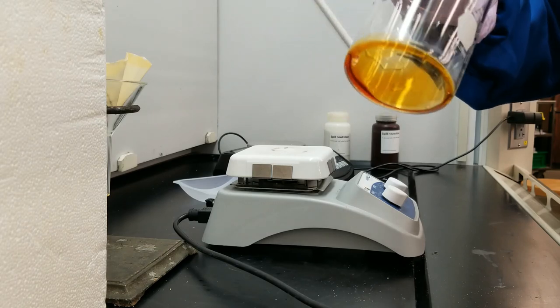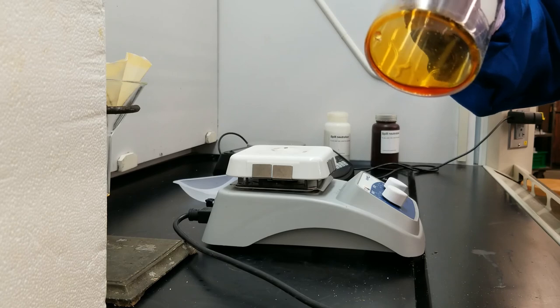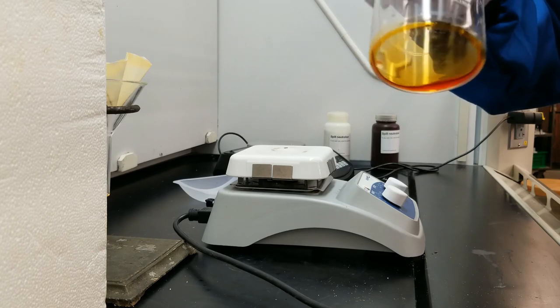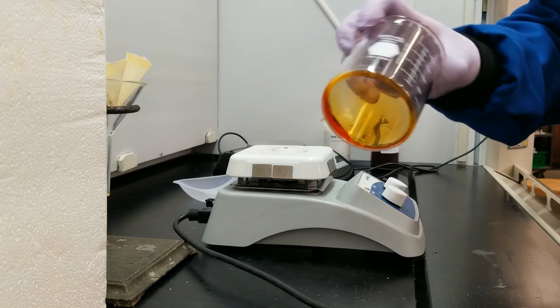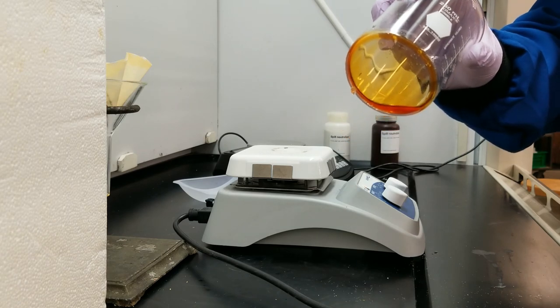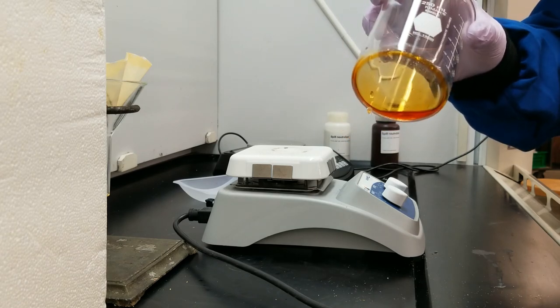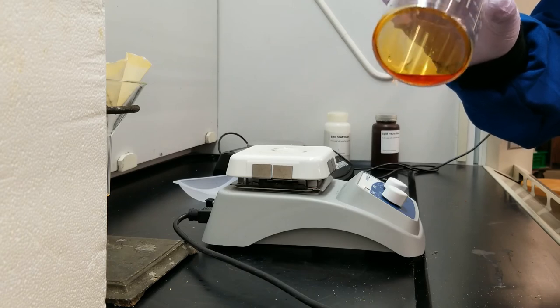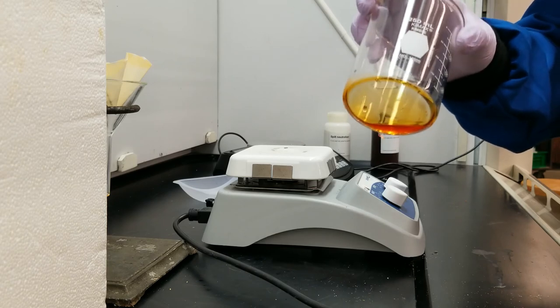Well, only 0.5 gram is saturated fat. So I might expect this liquid to be a little more viscous, but I wouldn't expect it to completely be solid. So now I'm going to go and wash this beaker so that I can get the mass of the empty and clean beaker to fill in my data table.